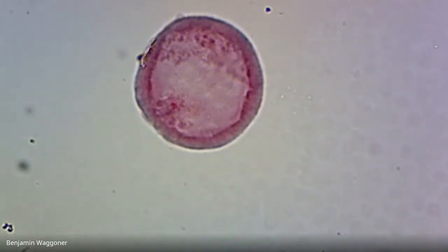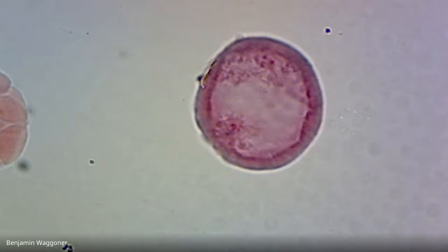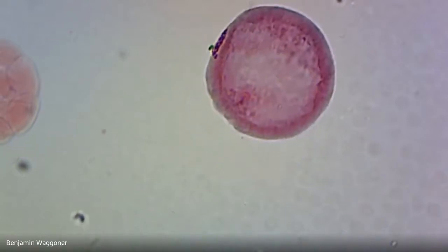At about your 12 o'clock, and again at about your 5, you can see just little clumps of red. That's probably the cells that are going to form the mesoderm. They're a cell population called mesenchyme, which is Greek for middle stuff. And so that's a late blastula beginning to move into gastrula stage.